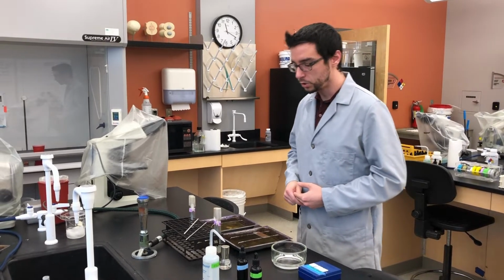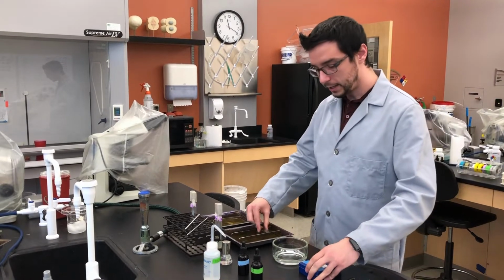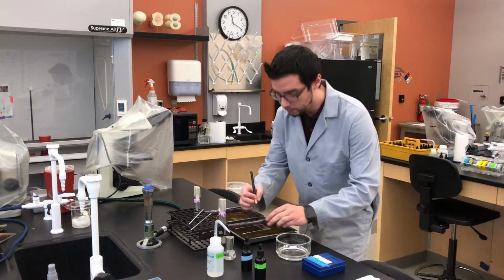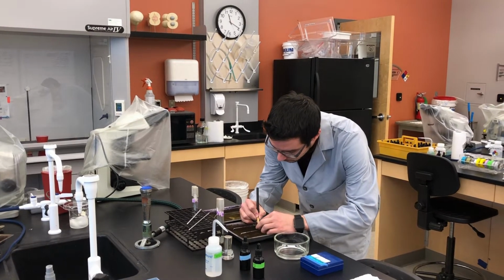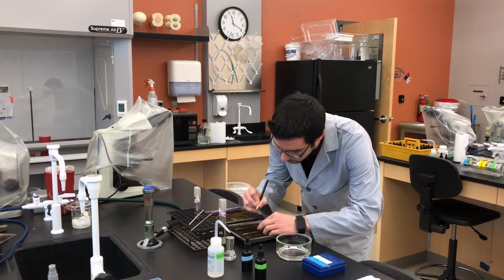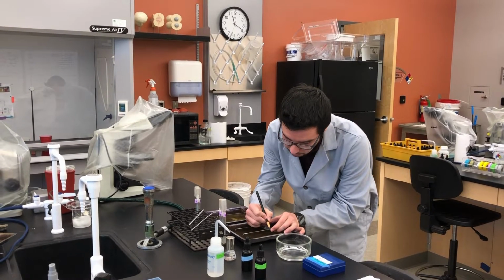Okay? So, to start, what we're going to do is get our slides out, and the first thing we always want to do is label our slides. That way we know which side is up and where we're putting our different cultures.